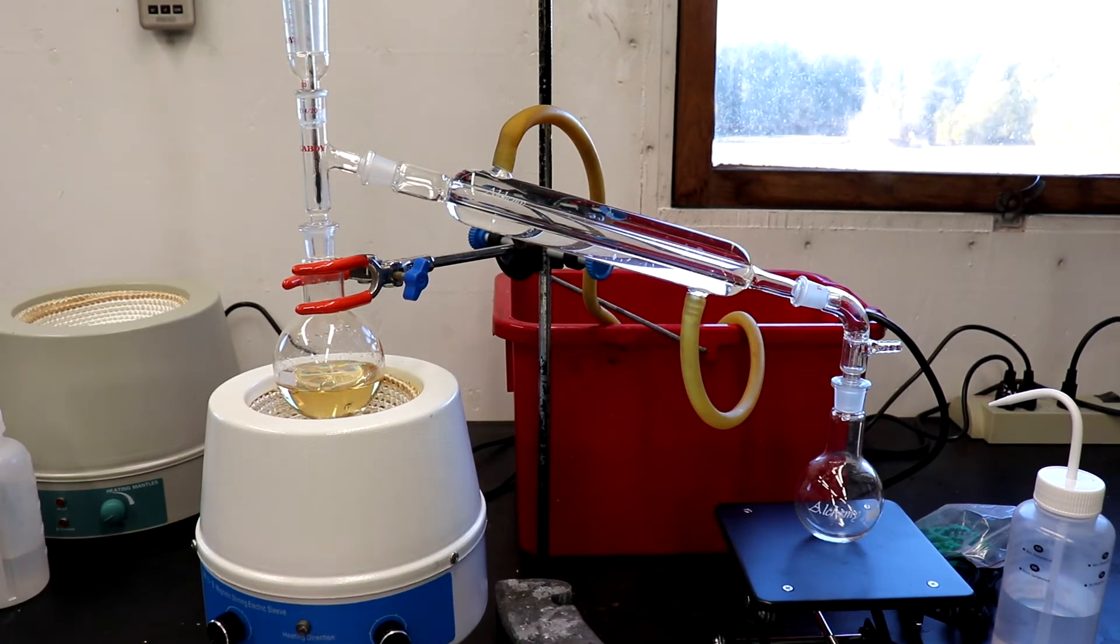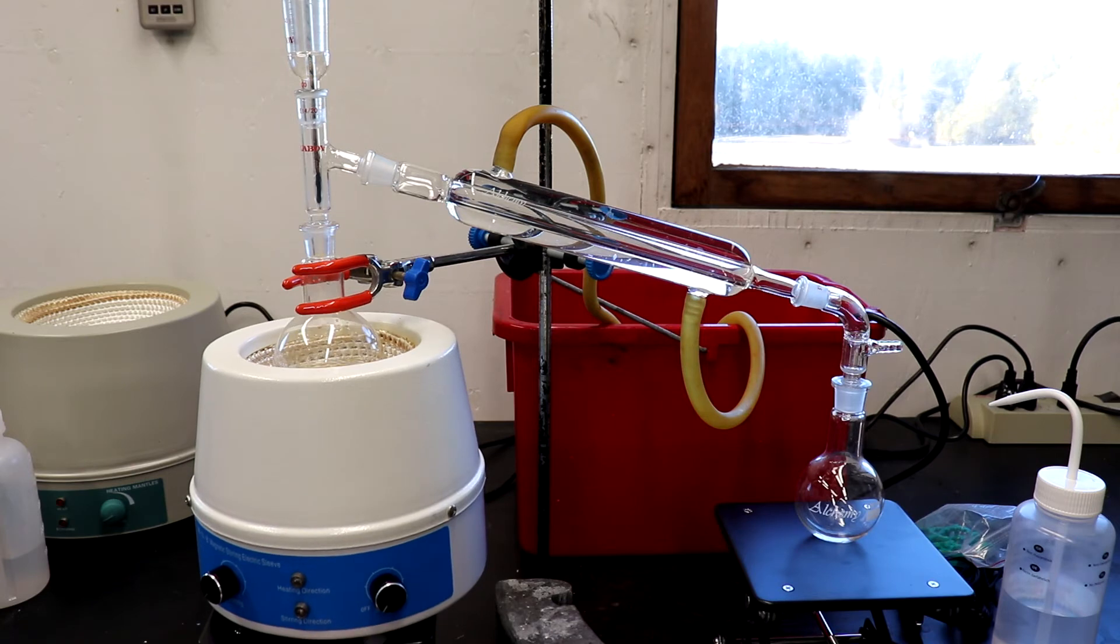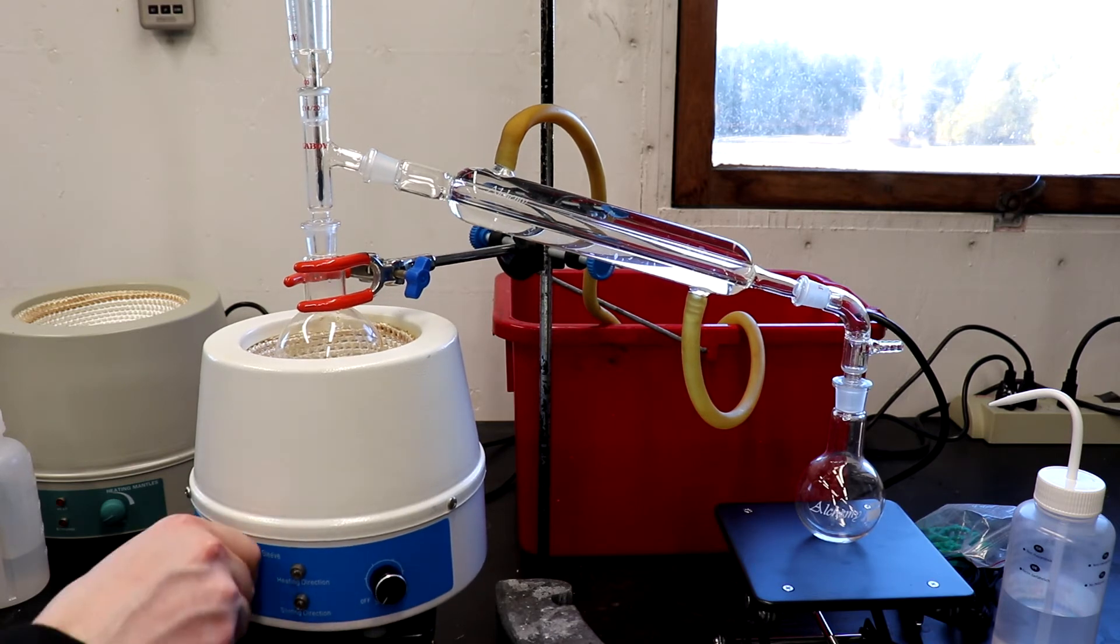I've set it for distillation, so we're going to raise the mantle and then we're going to turn on heating and stirring. And we'll get this distilling. This will be the final distillation.